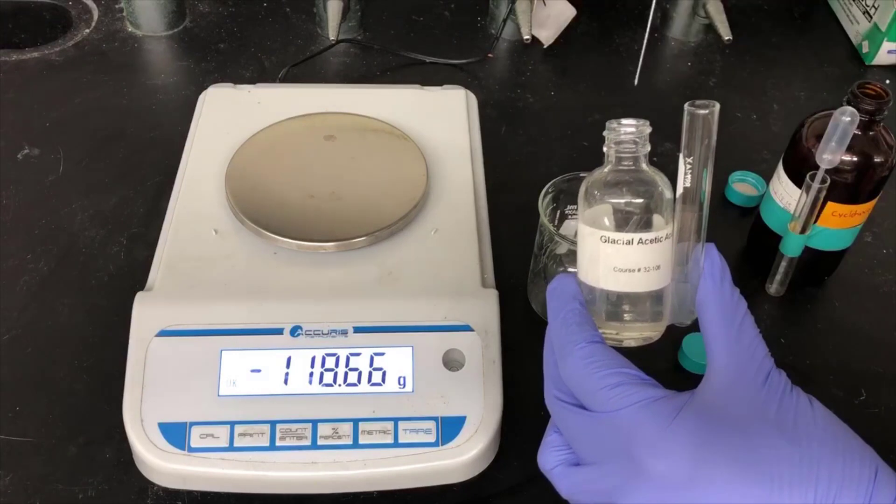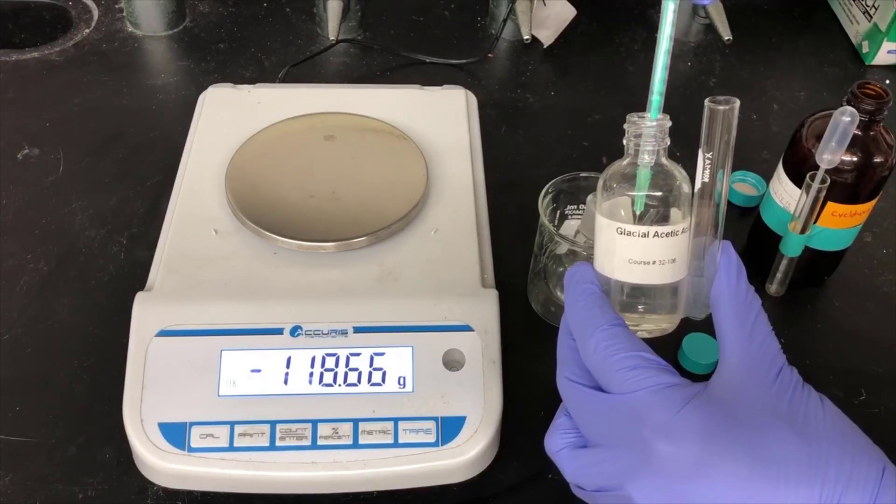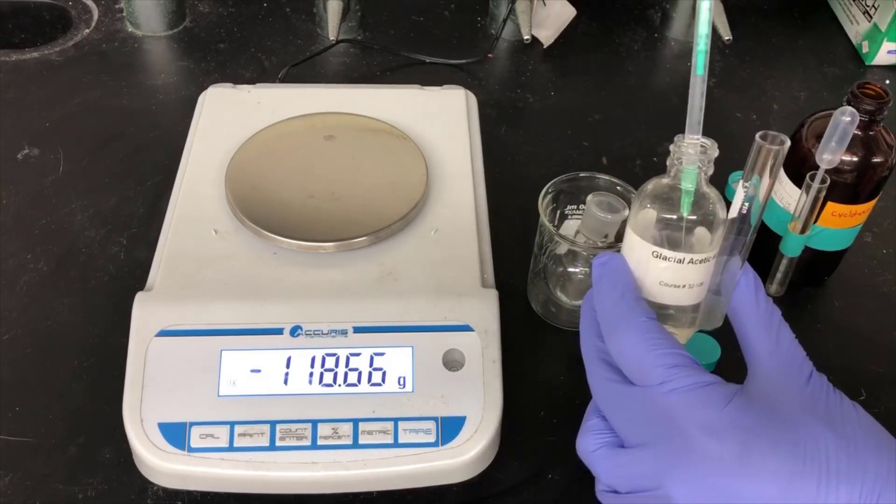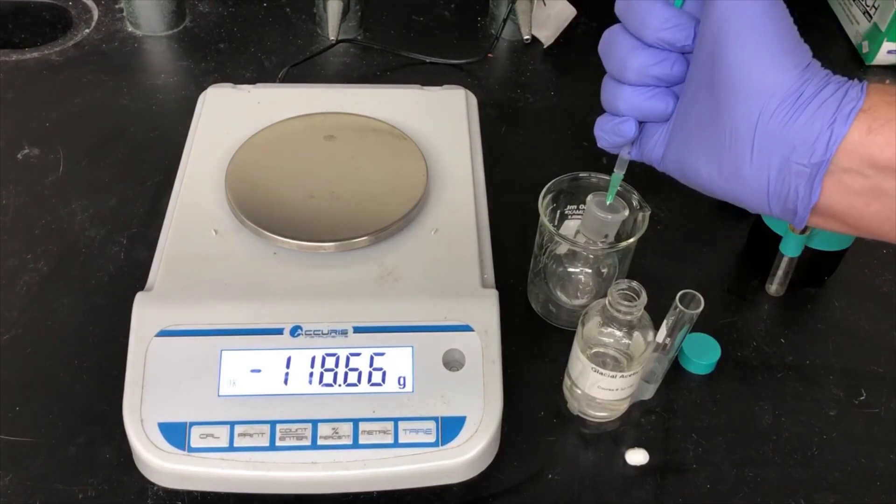Now I'll add glacial acetic acid, which is the catalyst in today's experiment. I'm using a syringe and needle here to measure out 0.80 milliliters.